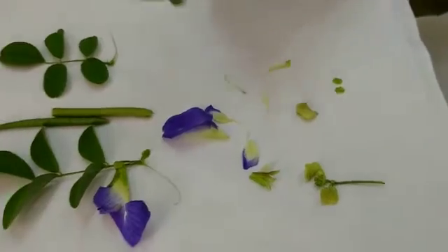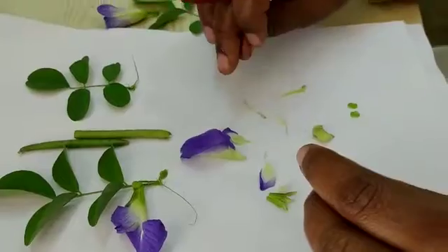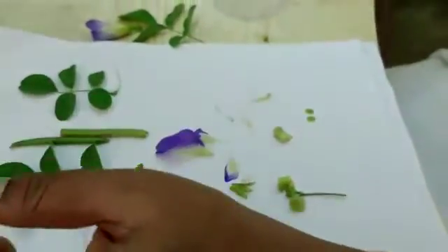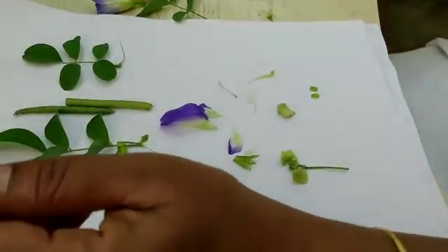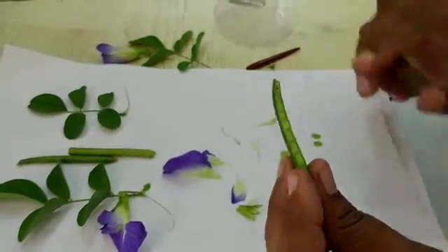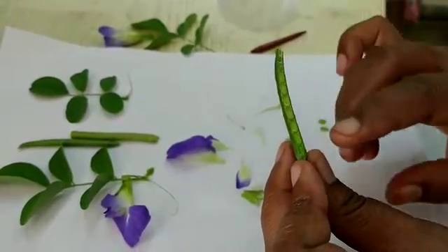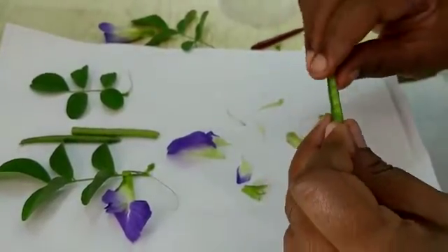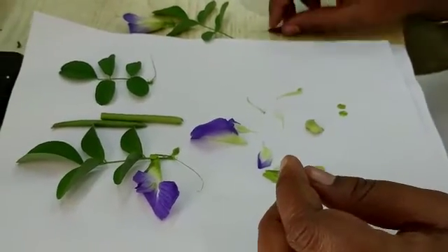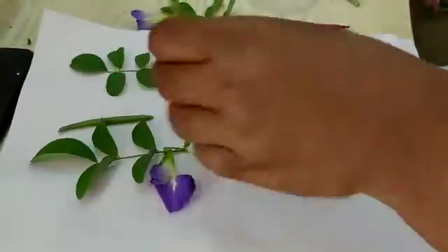Now we need to take the LS and TS of the ovary. Since it is very small, you can observe it under the microscope. Instead, I am using the fruit to show the marginal placentation. This is a member of the Leguminaceae family; I have taken the fruit in longitudinal section. In LS of the ovary you will get a structure like this, and the TS section will look like this.